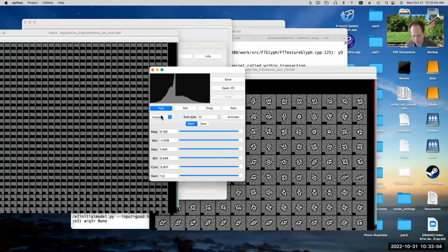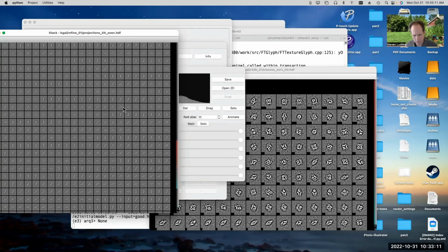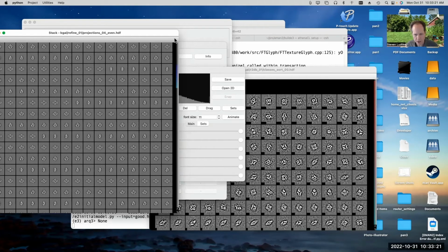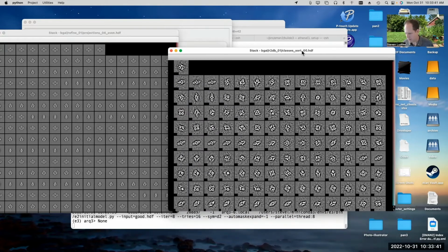Let me turn off the label. So what you'll see is there are views that look kind of like this. Maybe when we get all the way to the end here, you can see there's a lot of projections generated by the time that we're getting there. There are these end-on views like this, which basically look like a bright ring with a little bit of an elliptical area around the outside of it, but it looks primarily like a bright ring. And what happens in this data set is if there are a significant number of these ice contamination particles, those views get mixed in with these ice contamination particles.